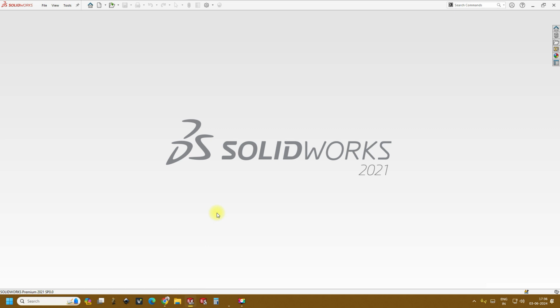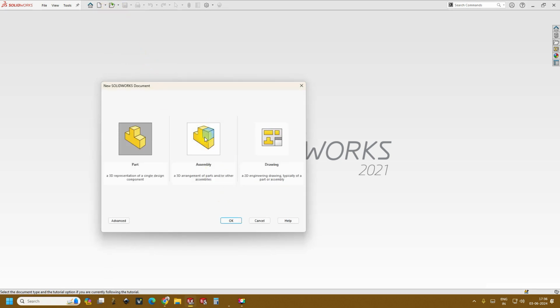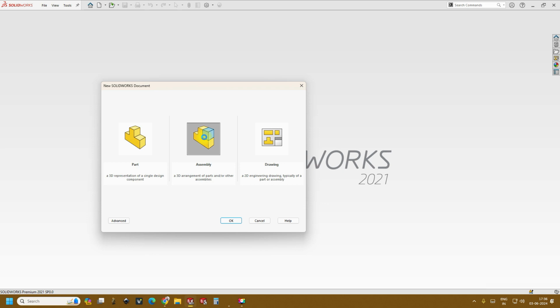Today we'll be doing the Y-Channel Microfluidic device on SolidWorks. Before going to that, just open a new part. So in that, let's first open an assembly, and in the assembly we'll create the microfluidic device.